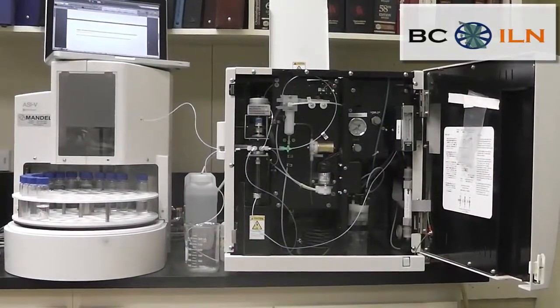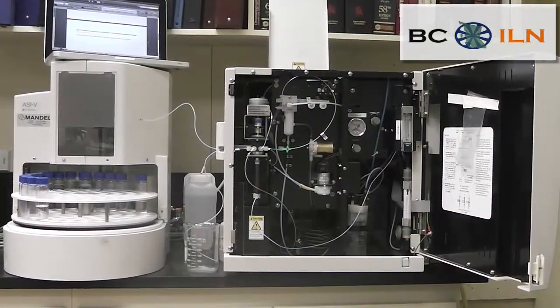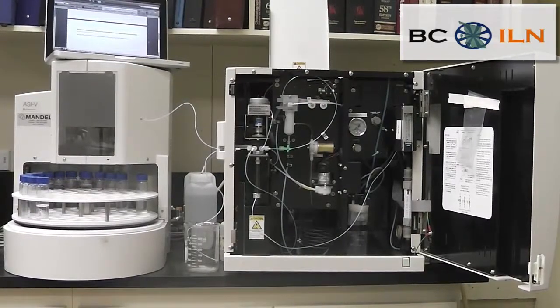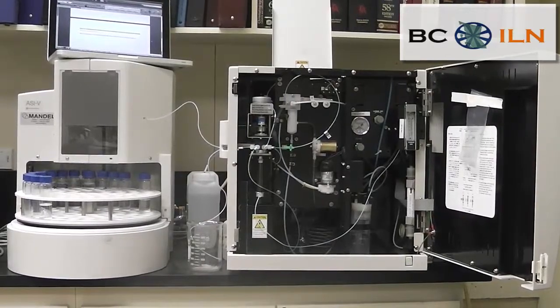So that is how the Shimadzu TOC-V analyzer works with regards to the total nitrogen. I hope this video was helpful. Thank you.